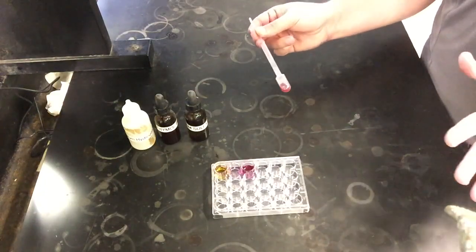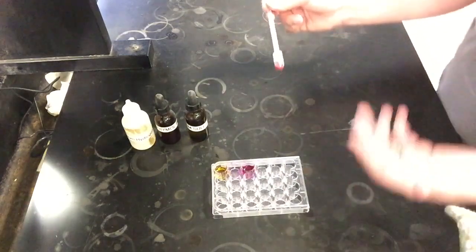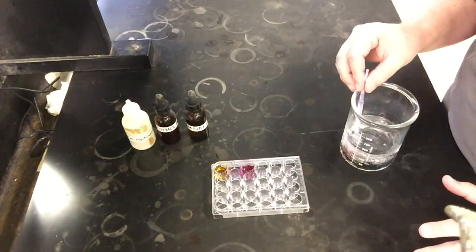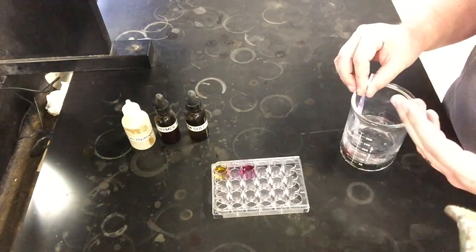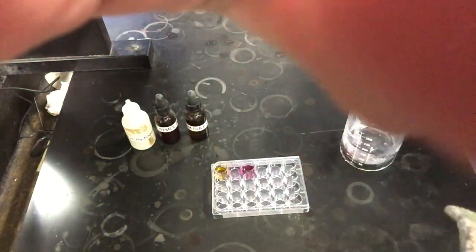So to double check that heating the reaction made it go towards the reactant, similar to what our first step did, I'm also going to put this in an ice bath. I'm going to have to bring the ice bath on screen, that's fine. I'm just going to submerge and hold this in an ice bath for a couple minutes. Again, I'm not going to videotape the whole process where you have to sit and wait. I'll show you the clip of after a couple minutes, just so we can see what the color change looks like.